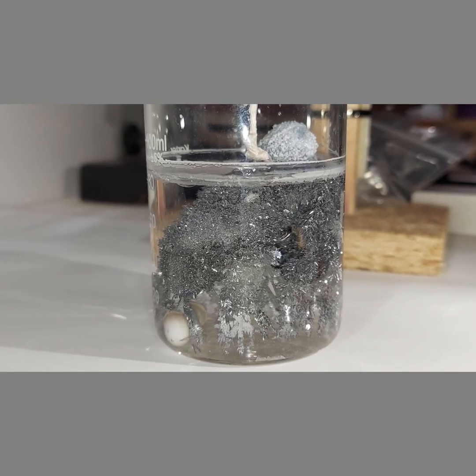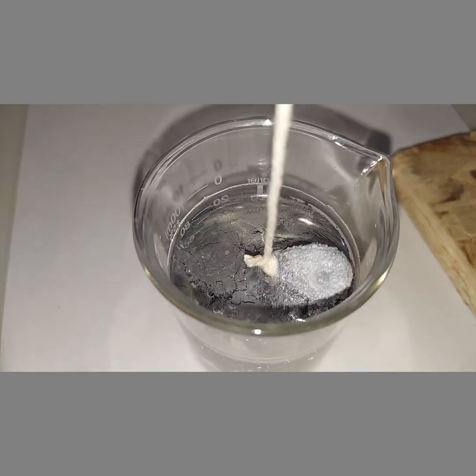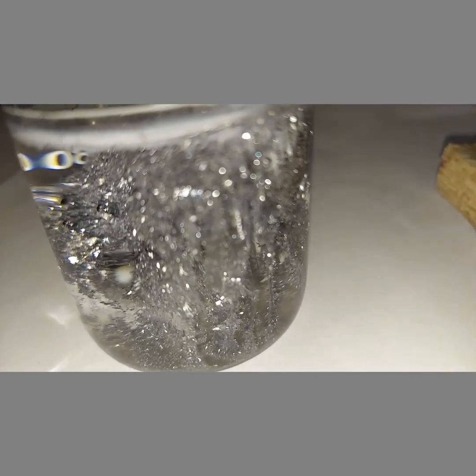It's been 66 hours and there is a jungle of lead crystals in there. Some of those have drooped down and touched the bottom of the beaker. This is a view from the top which looks like muddy water, but not down here.